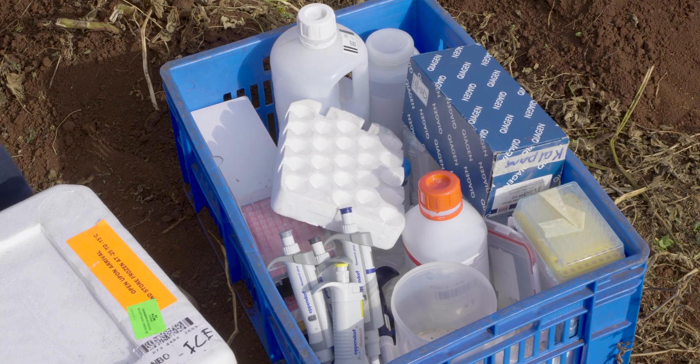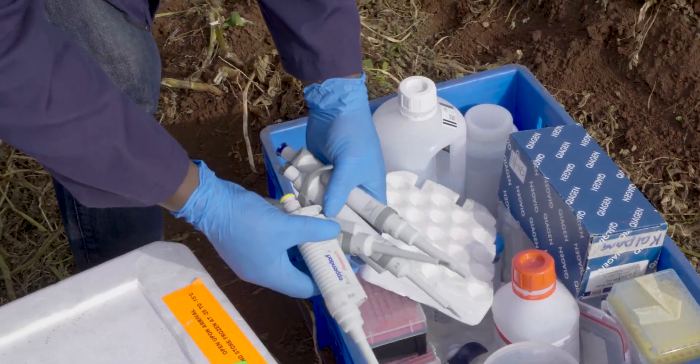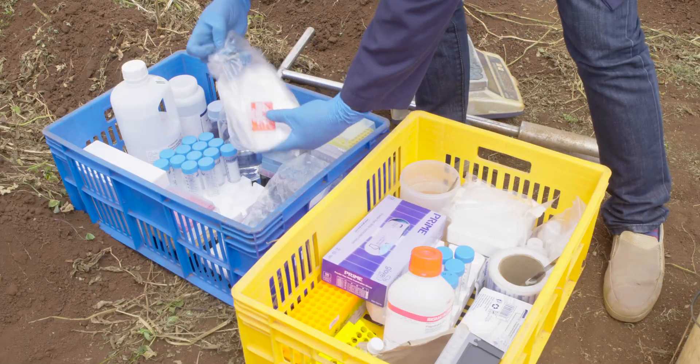In this video, we'll take you through the steps on how to use a field deployable LAMP assay in Ralstonia solanacearum diagnostics.